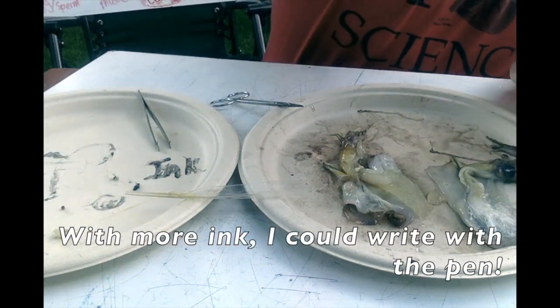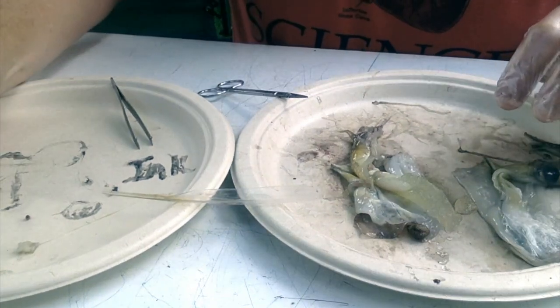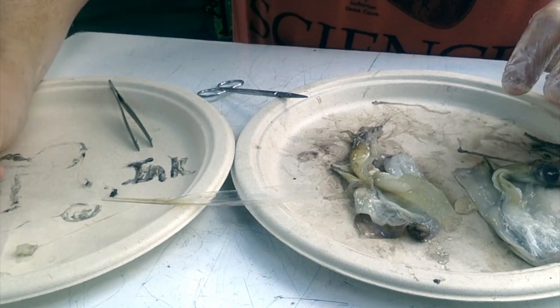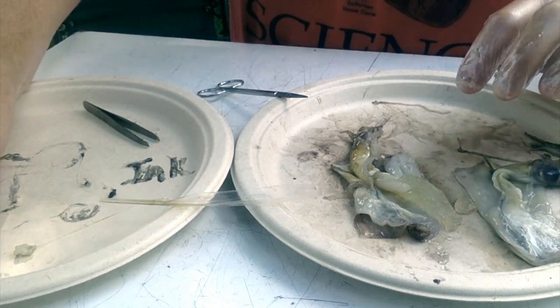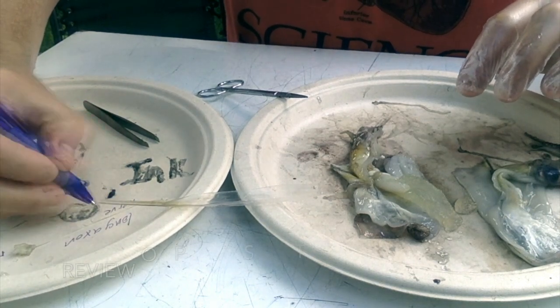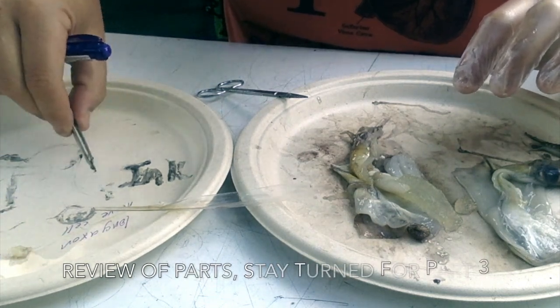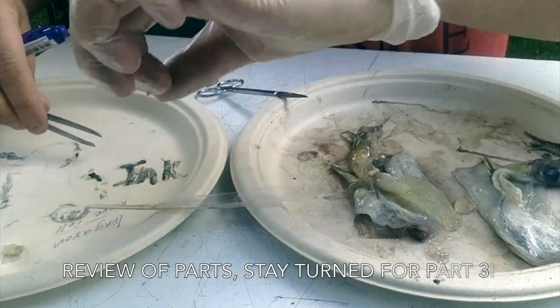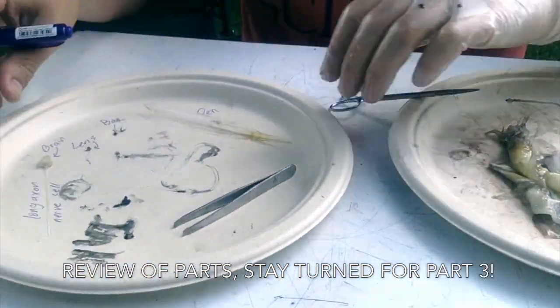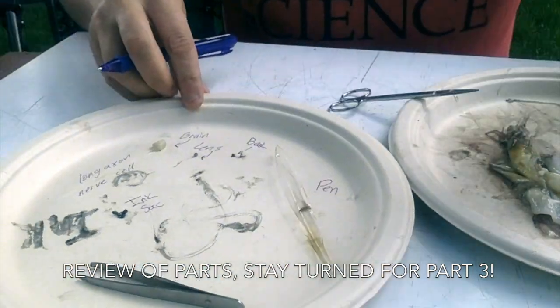And so, just to go over a couple of the different points that we have here, I have a beak, a lens. I'll turn this so you can see it in just a sec. This is the brain. This is that long axon, or nerve cell. All right, so that's more part of the beak here. And, of course, we have some of the ink and the ink sac. And then this will be the pen. And so we have all the different parts that we have pulled out of our squid.